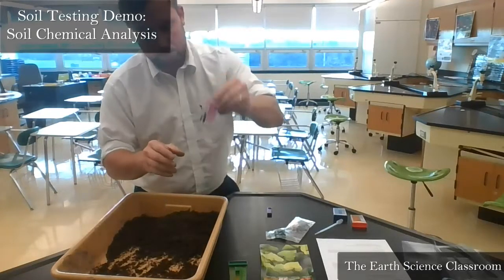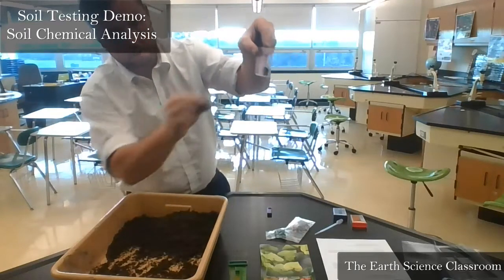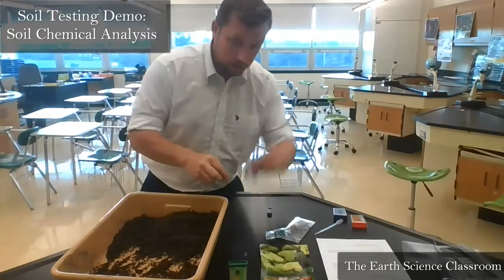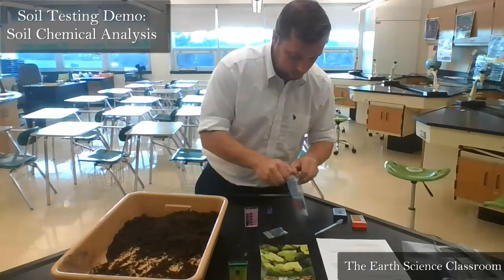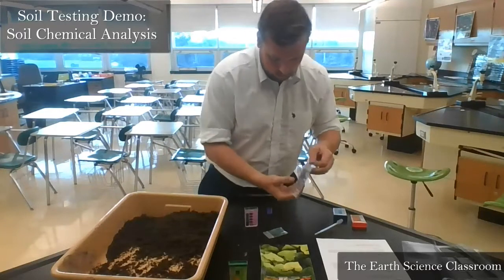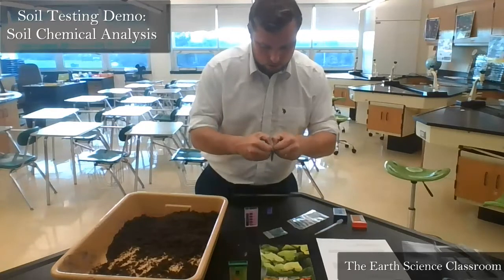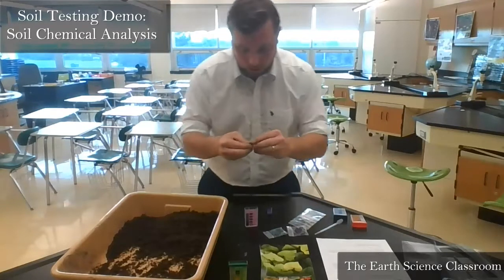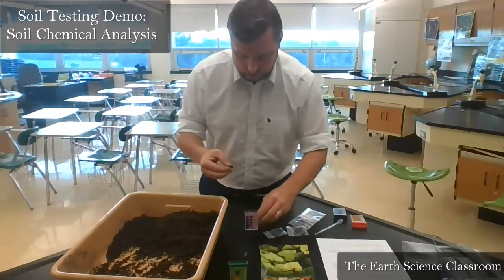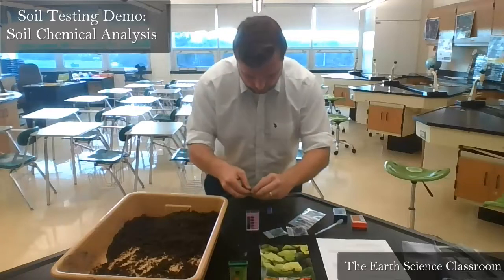Okay, a bit too much. There we go, like that. Okay, a little bit of soil like that. This is purple, so we get the purple chemical indicator in our lab, like so. Take one out. One capsule, one indicator per testing time. Okay, so we again twist.